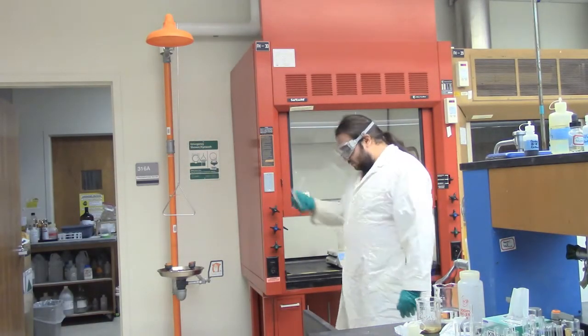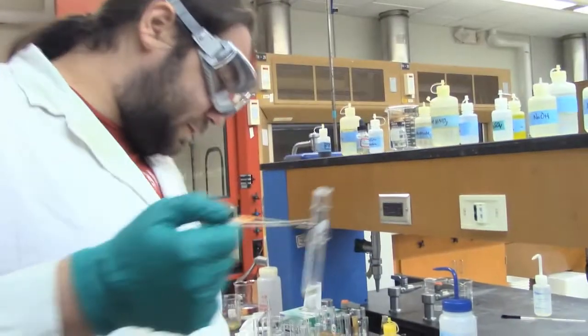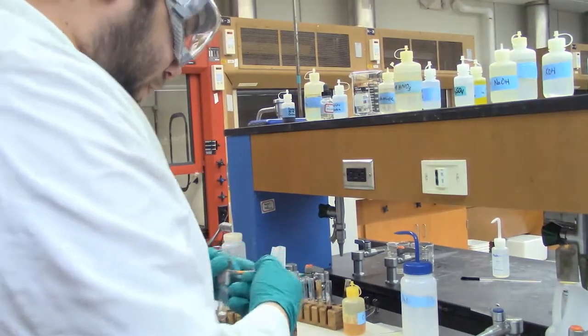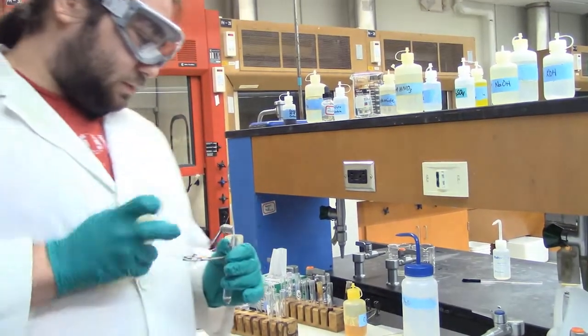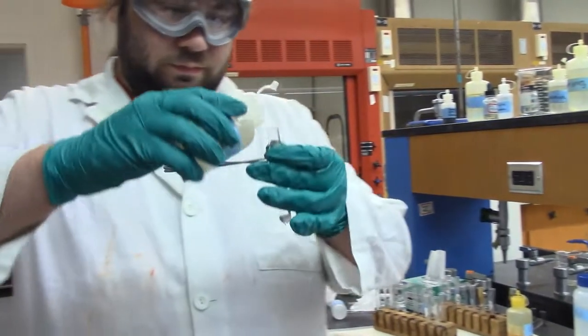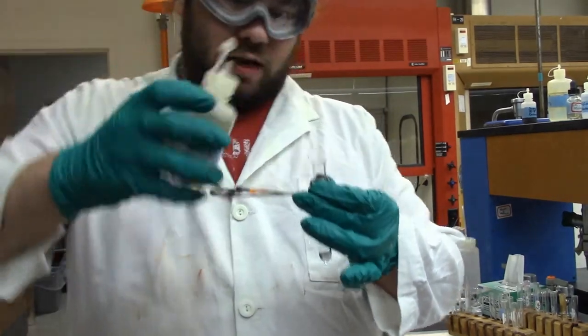So we'll take it out. So yeah, that's dissolved. Then we're going to add 3 more drops of our acetic acid. Did I put it back up there? Or no, here it is. Got the nice strong vinegar smell due to it being vinegar.